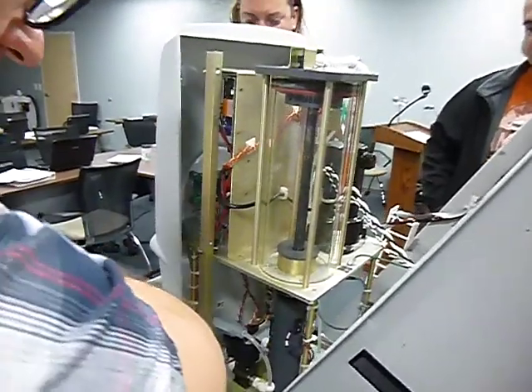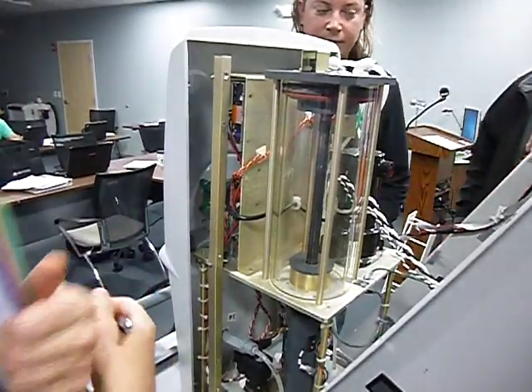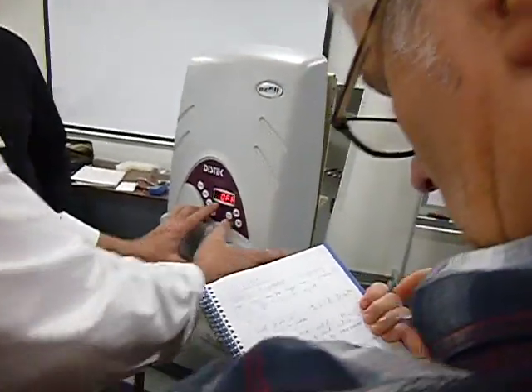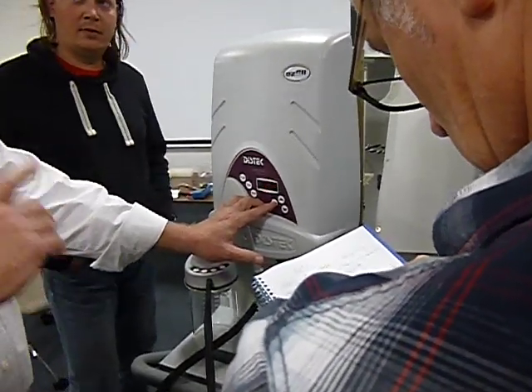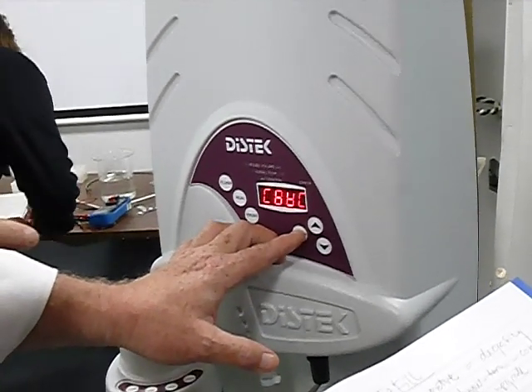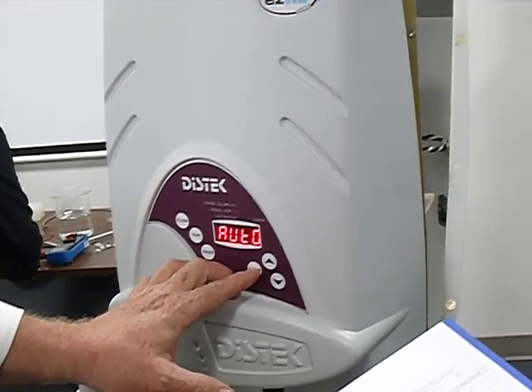All right. So what is the SLS mode? Boris, you want to put it in SLS mode? I'm not sure that I remember how, but okay, I'll do it. It is for foamy media. When you come in here to setup, you hit the up button for 3 seconds, I think, and the setup. SLS, off. We're going to put that on. What does SLS mean? SLS is soapy media, when the chemists have something foamy, something soapy. Now we calculate by volume or by mass, weight. I just keep it by volume.